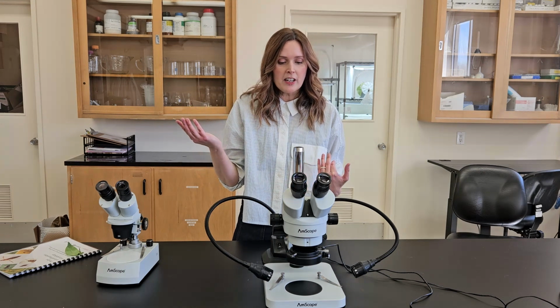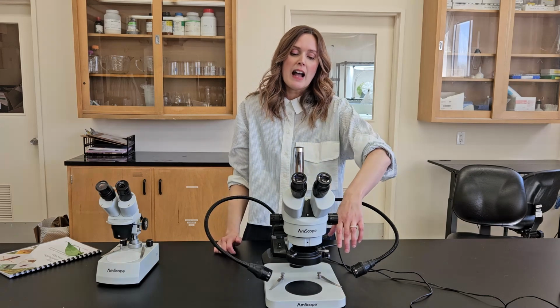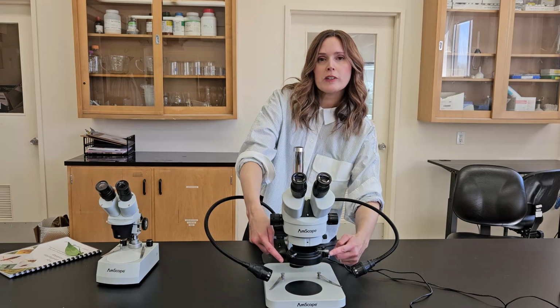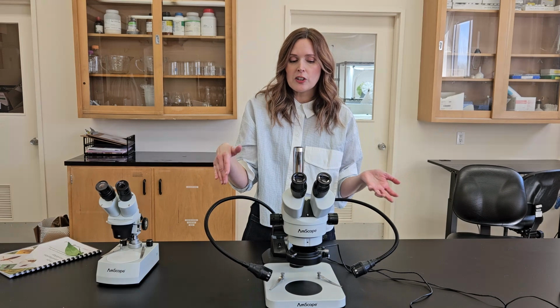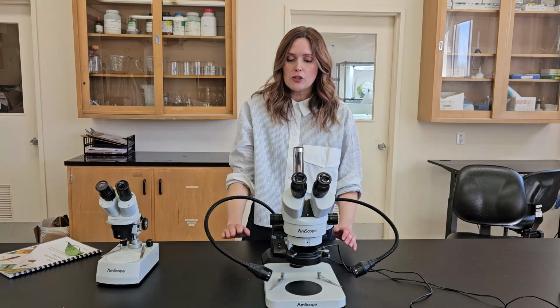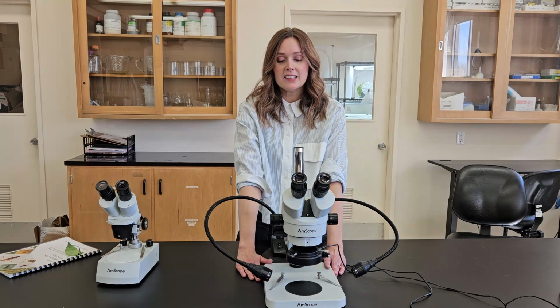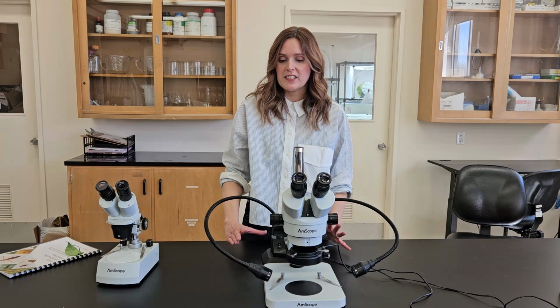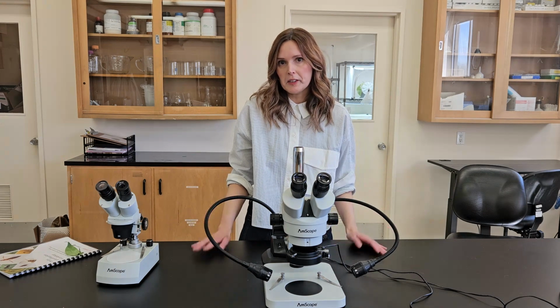So I think overall, I prefer the gooseneck ones. In our lab, we do have a ring light where you can control which quadrant of the ring light is on, and that helps decrease the glare. So there's lots of options out there. Just make sure when you're buying the microscope to understand whether or not it has a light source included, and if that's another expense you're going to need, and what's compatible with it and what's not.